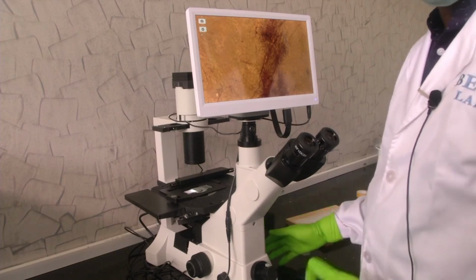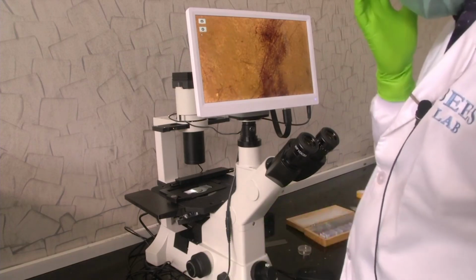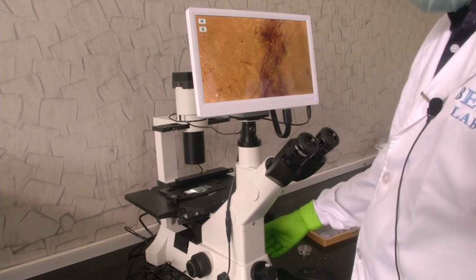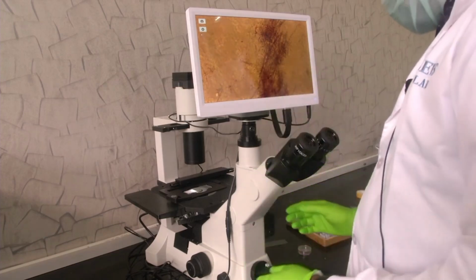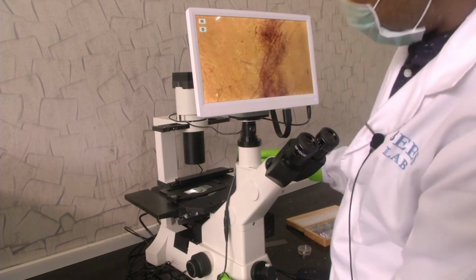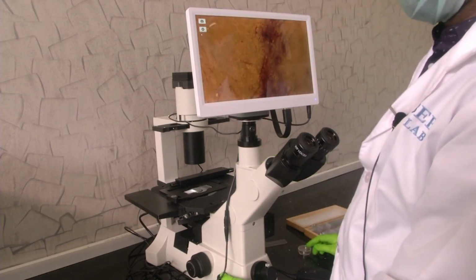You can pronounce it fungi. There is one pronunciation that they just follow, that is all. It is the plural for fungus. So, fungi. This should be clear to you now. Now, if we adjust the brightness, the light intensity that is falling on it, that image will become brighter. If you reduce it, it will become darker.